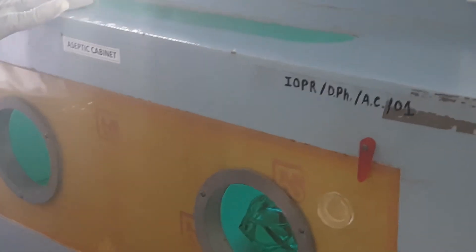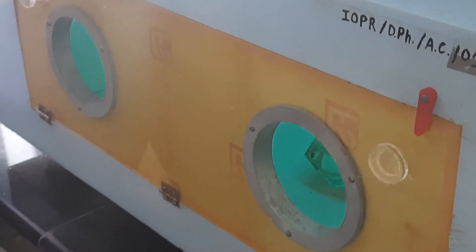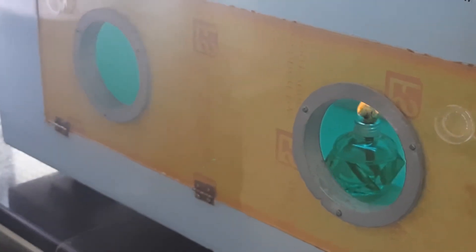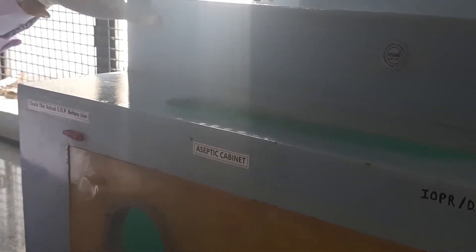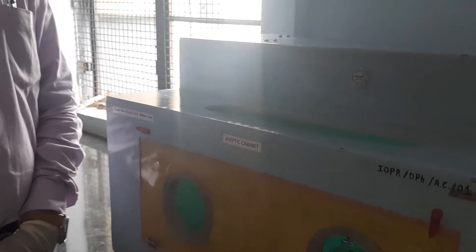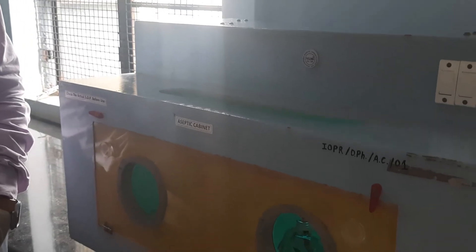As an instrument, this cabinet is light in weight and can be moved from one place to another without any difficulty. The screen is a box-like structure with a glass sloping front.